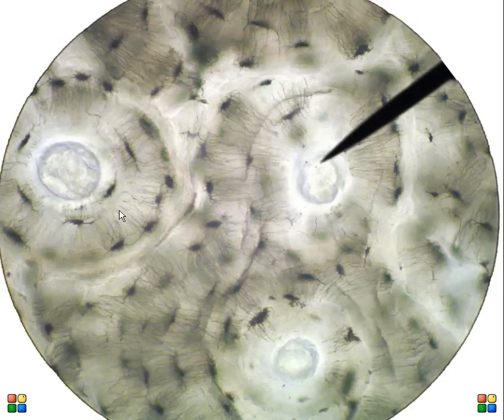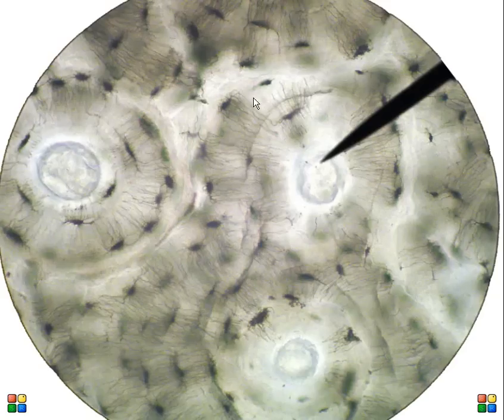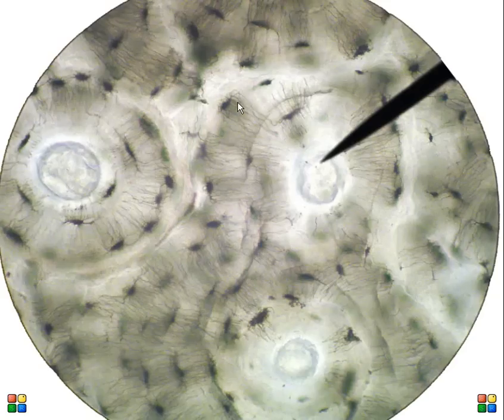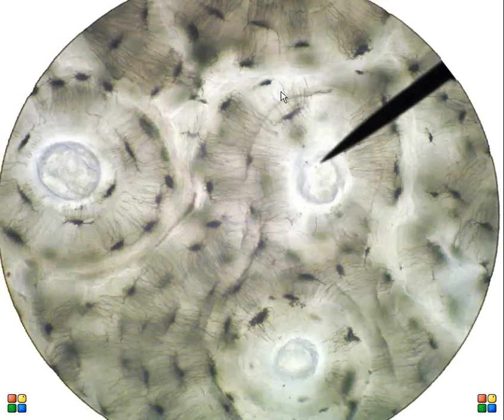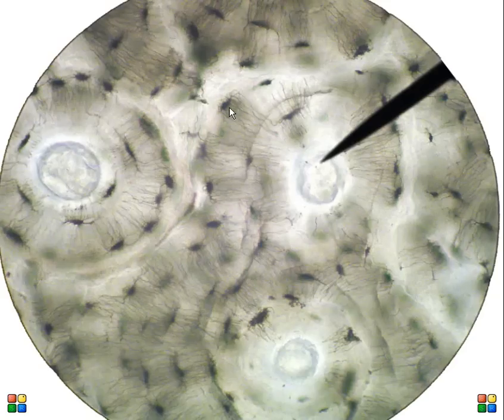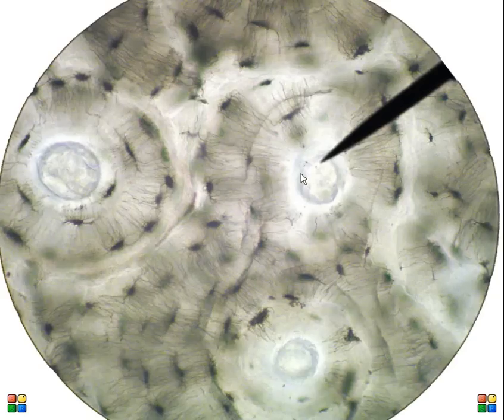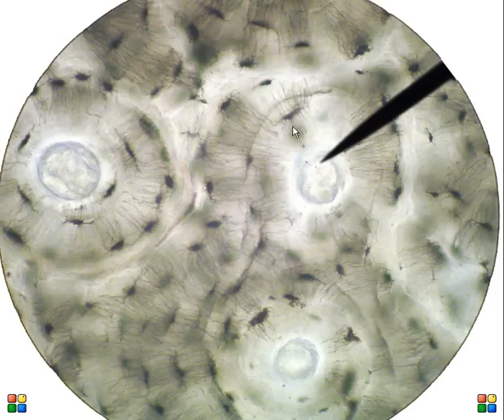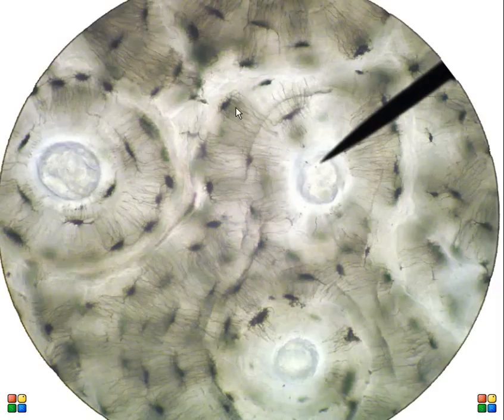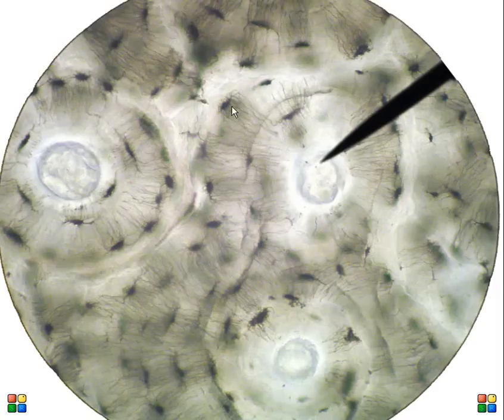We can also see these dark black lines now pretty well, and those dark black lines are communications between the osteocytes and the central canal. Those communications are called canaliculi.